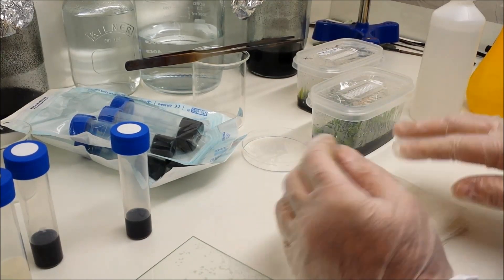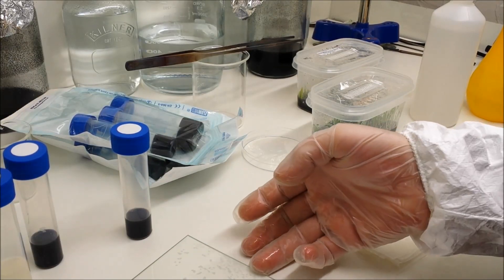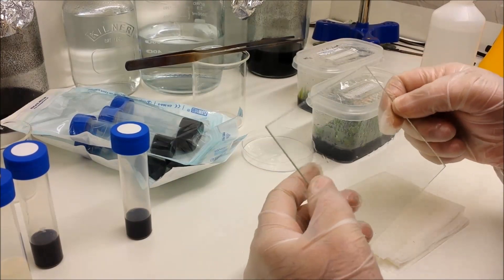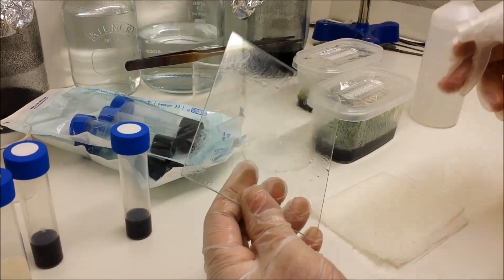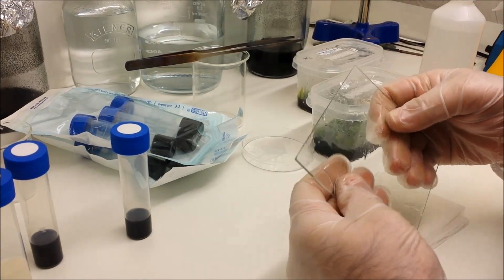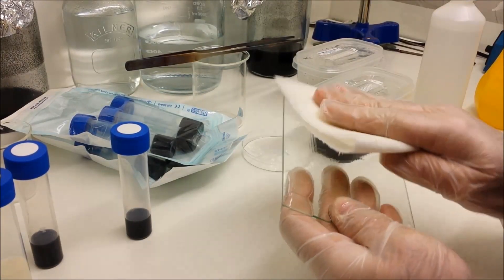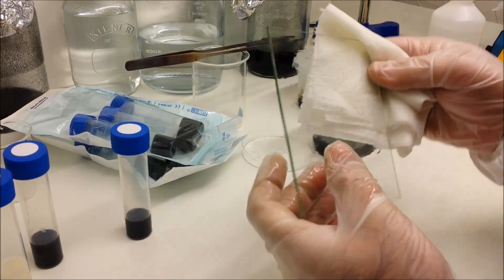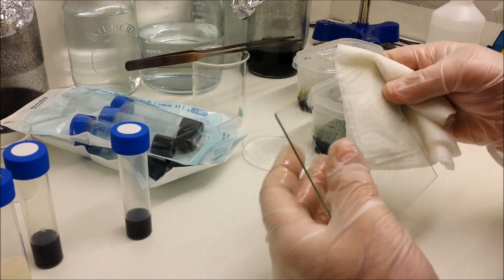This is also coated or soaked in isopropyl alcohol. I'm using a sheet of glass which again is sterilized using the same IPA to make sure that there's no bacteria of any description, no yeast, no fungal spores of any description in there, just to keep the contamination down. So give that a good wipe and place it down on the sterilized surface.